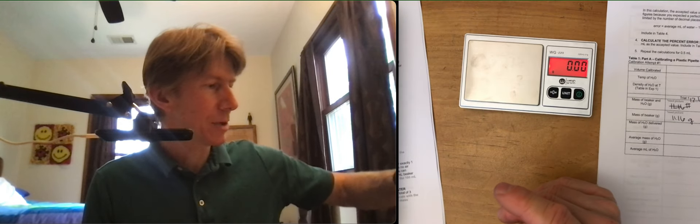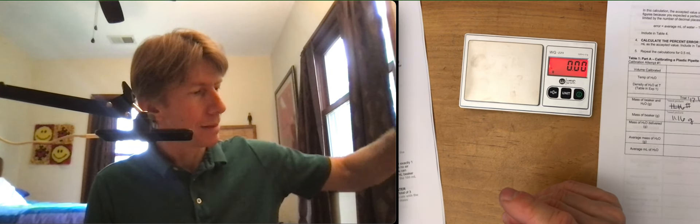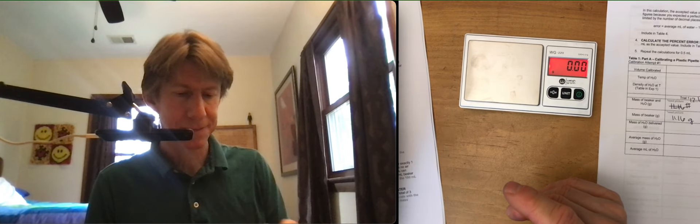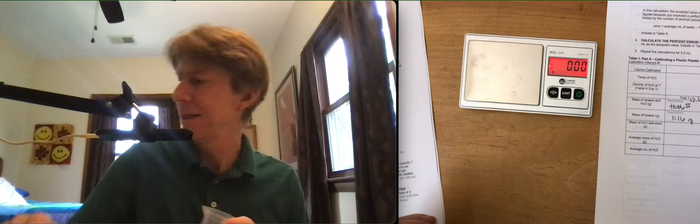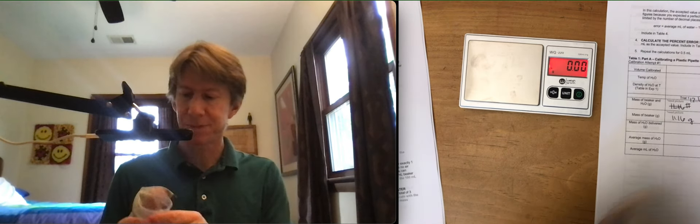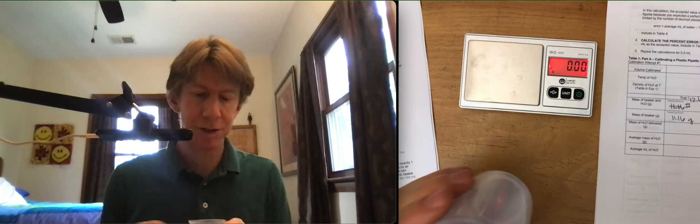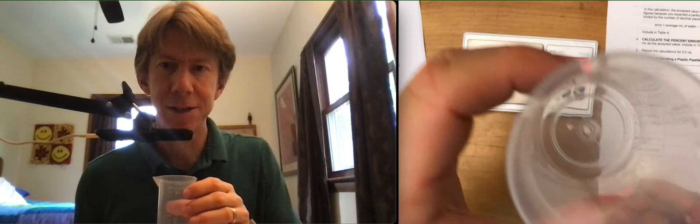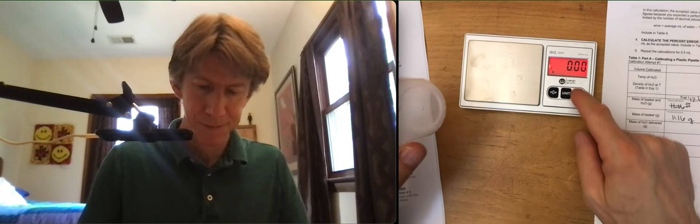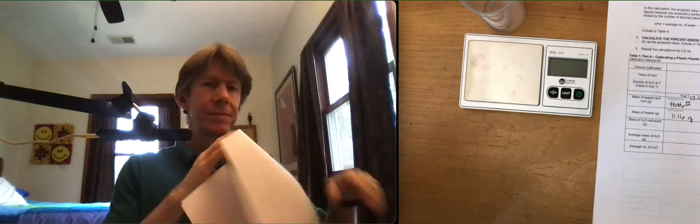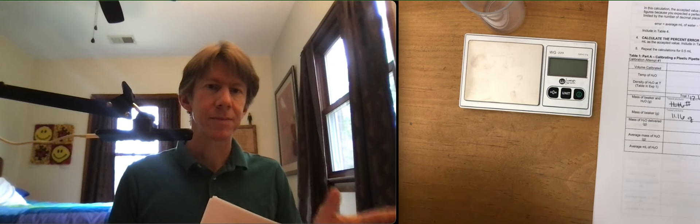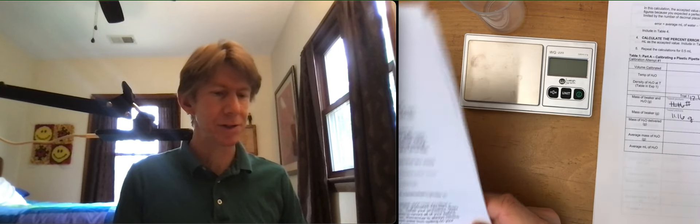Make sure the outside is dry. You can dry the inside too, but you don't have to. I don't know if you can see any droplets of water in there. Take your time with these measurements. Make sure you do them right.